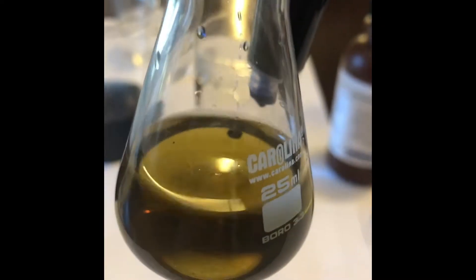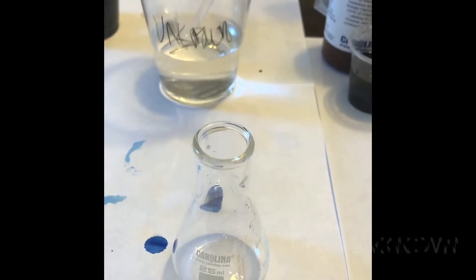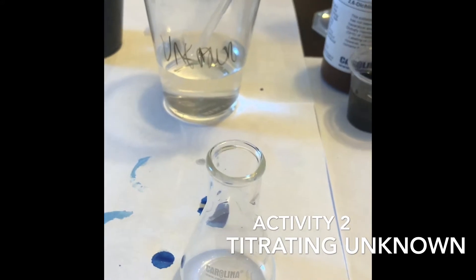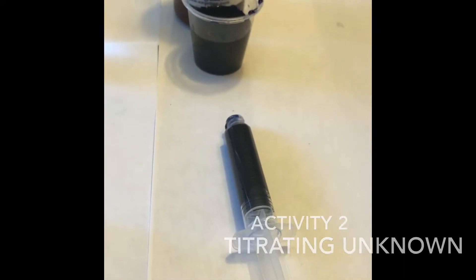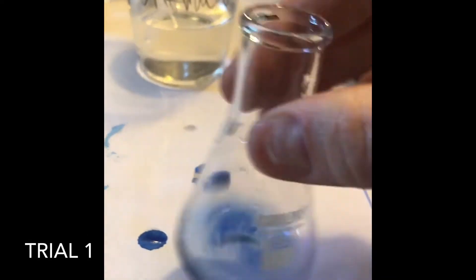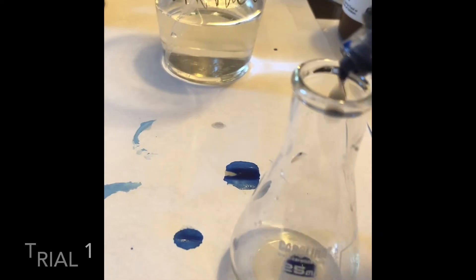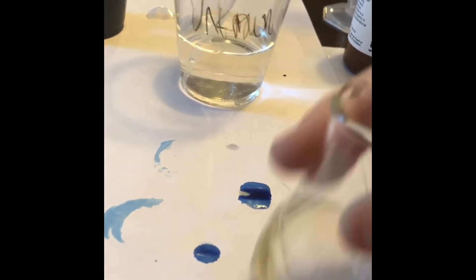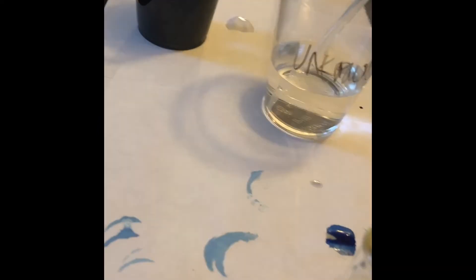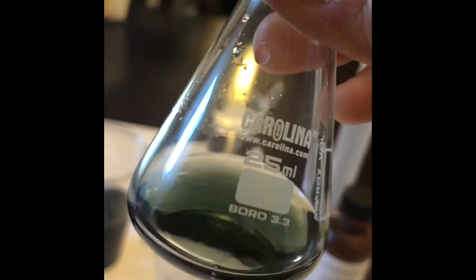For the 2.0 gram per liter ascorbic acid sample, again just that persistent green color and I'll record. Activity 2 is titrating the unknown concentration. Transfer 2 ml of the unknown sample into the Erlenmeyer flask and then fill your syringe with 5 ml of DCPIP. There's my bluish-green color — I got it with 0.4 ml left.